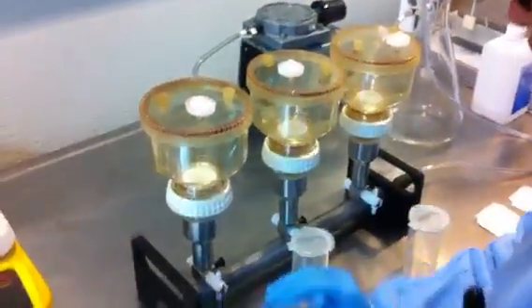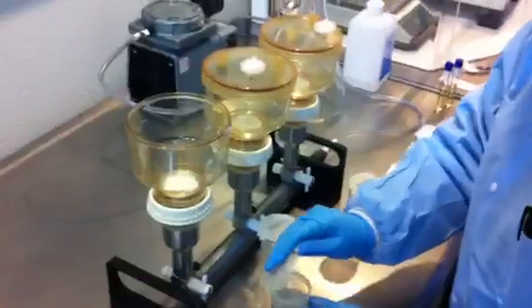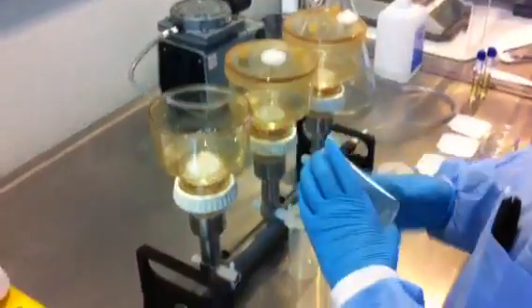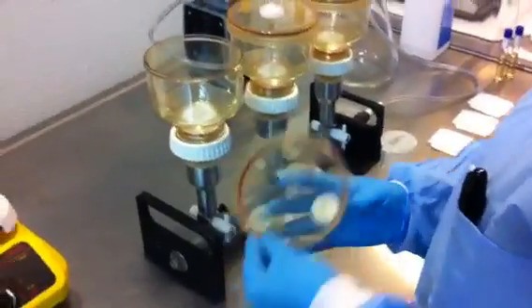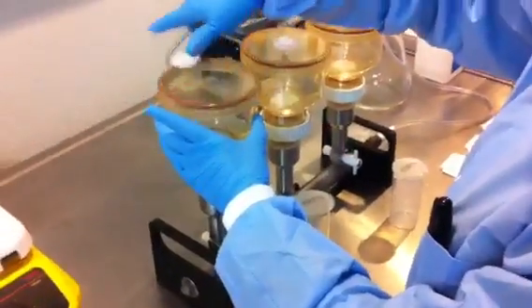And then the final one — she pours it in. This is not the Sartorius system, but it gives you the general idea of how membrane filtration is done.